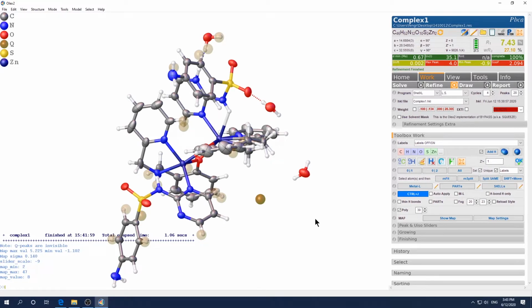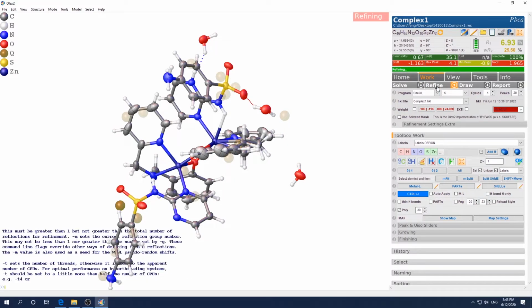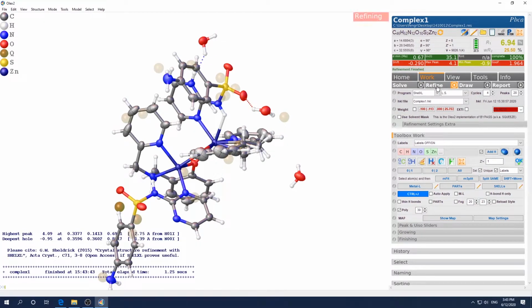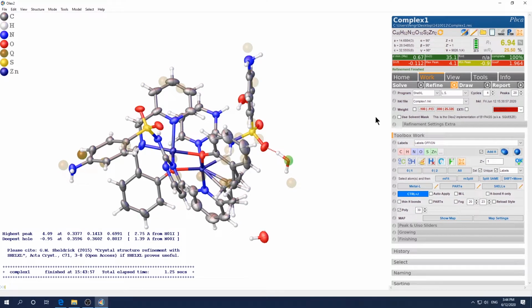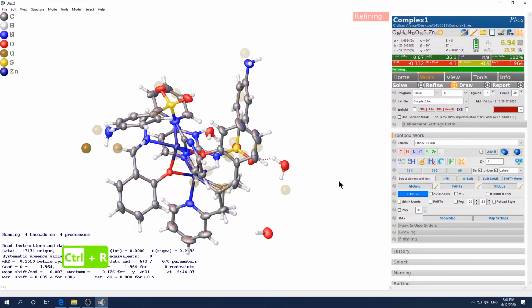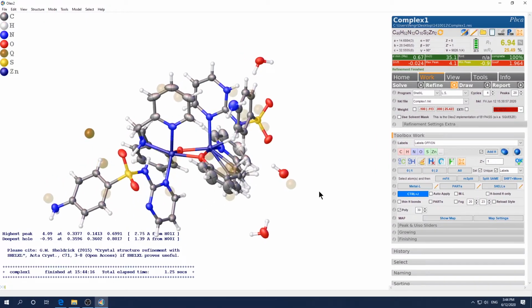Okay, now click refine. Yeah, refine a few more times. Refine. So mainly you can see this hydrogen are rotating, trying to find the most comfortable position, most low energy position. Okay, let's see what it is. Yes, still this oxygen is not settling down. Let's see. Yeah, it's getting better. Okay. Yeah, it's rotating around, trying to find a comfortable position.